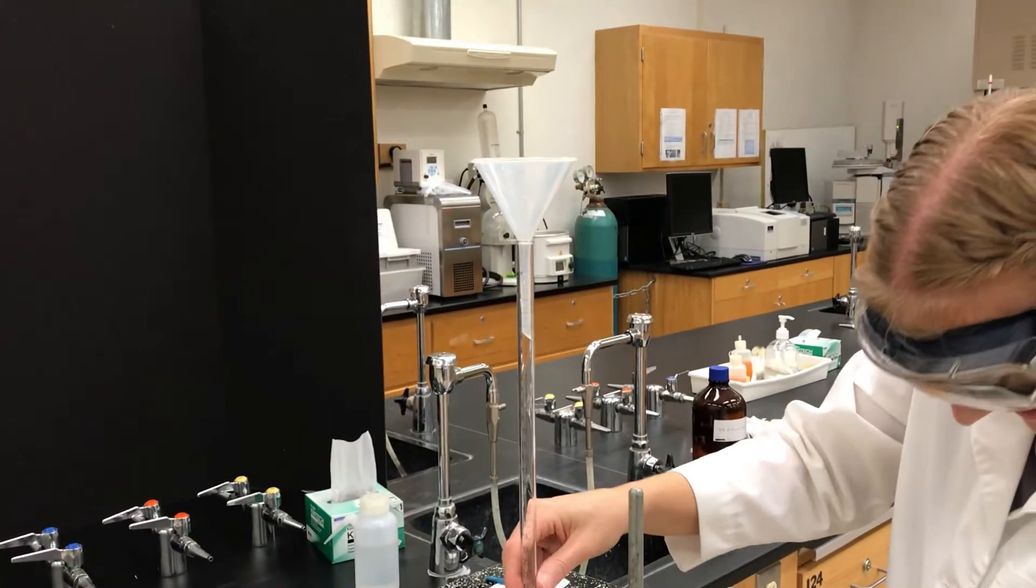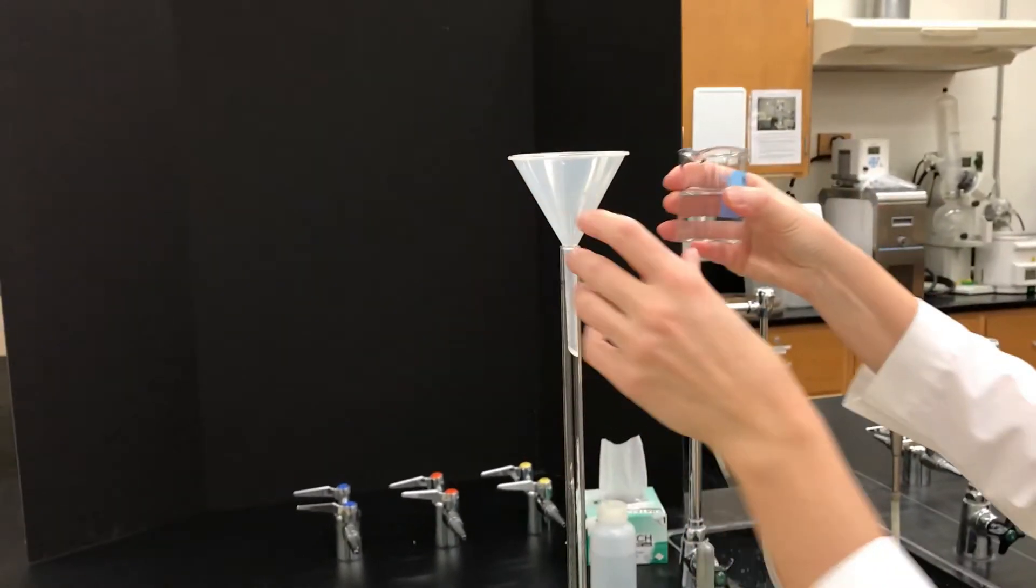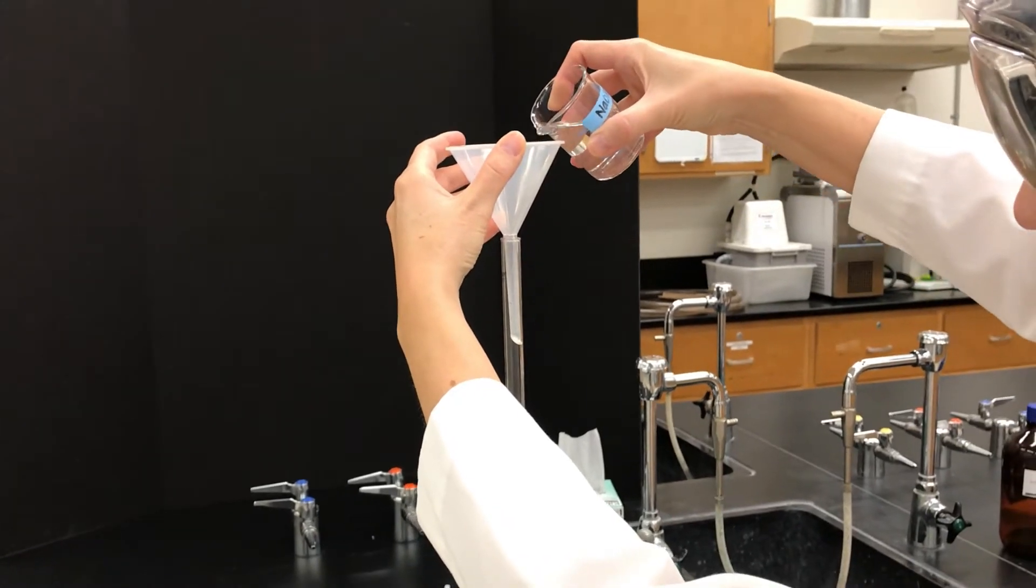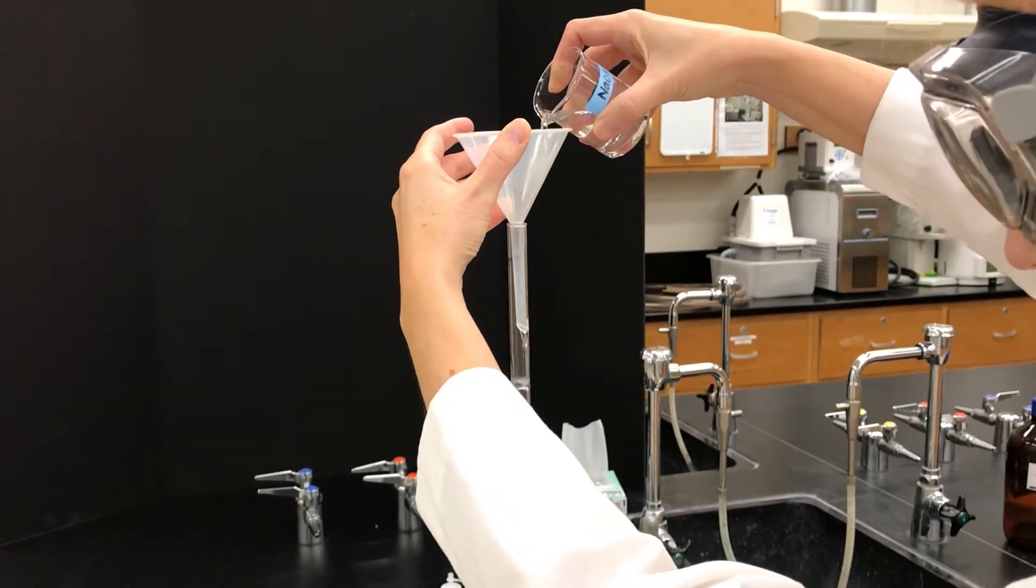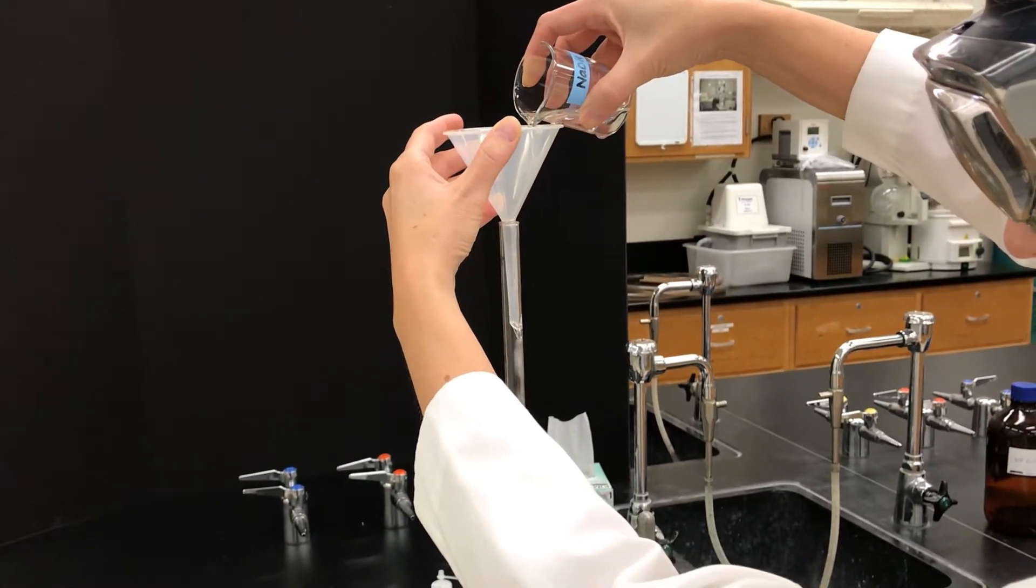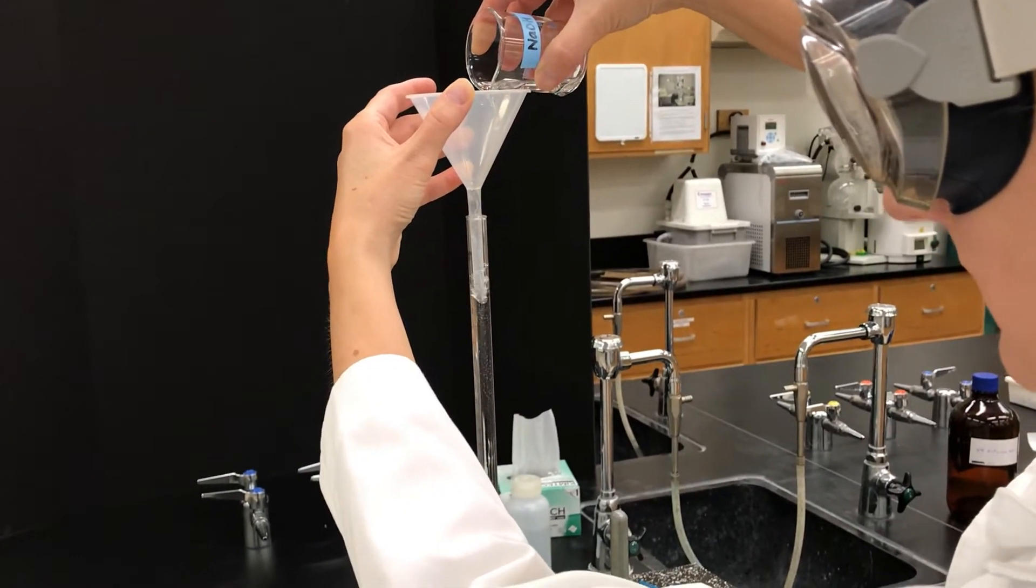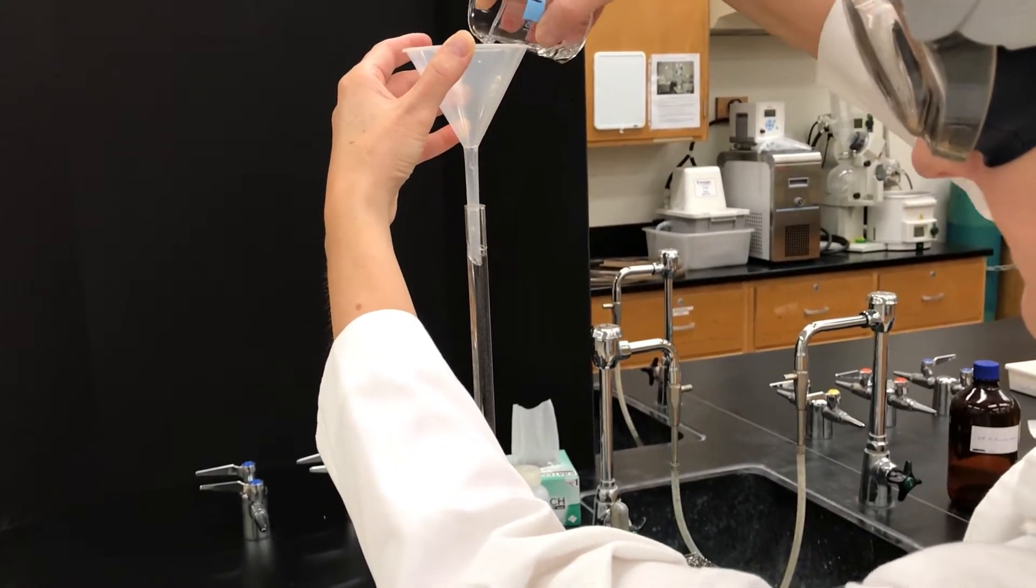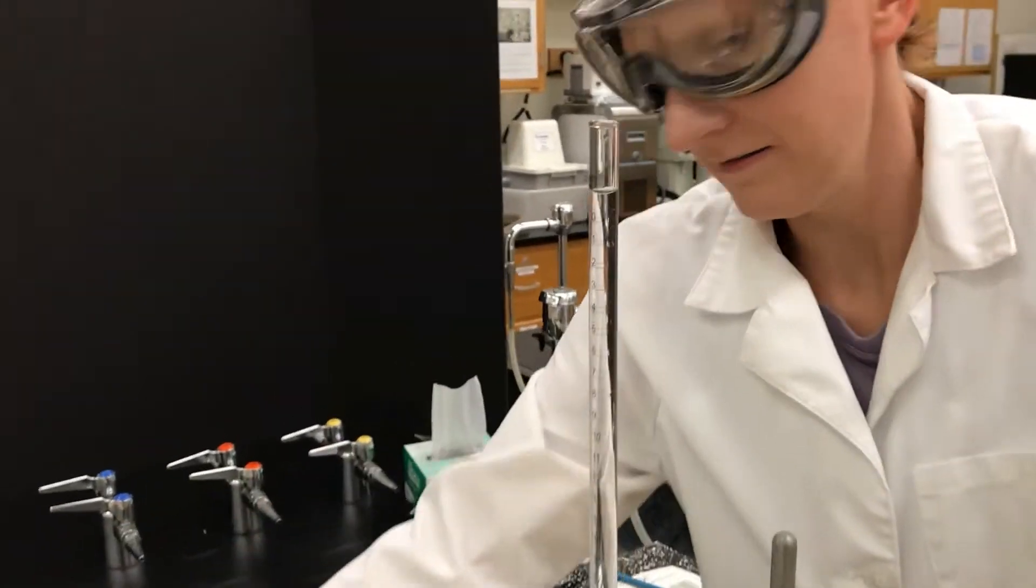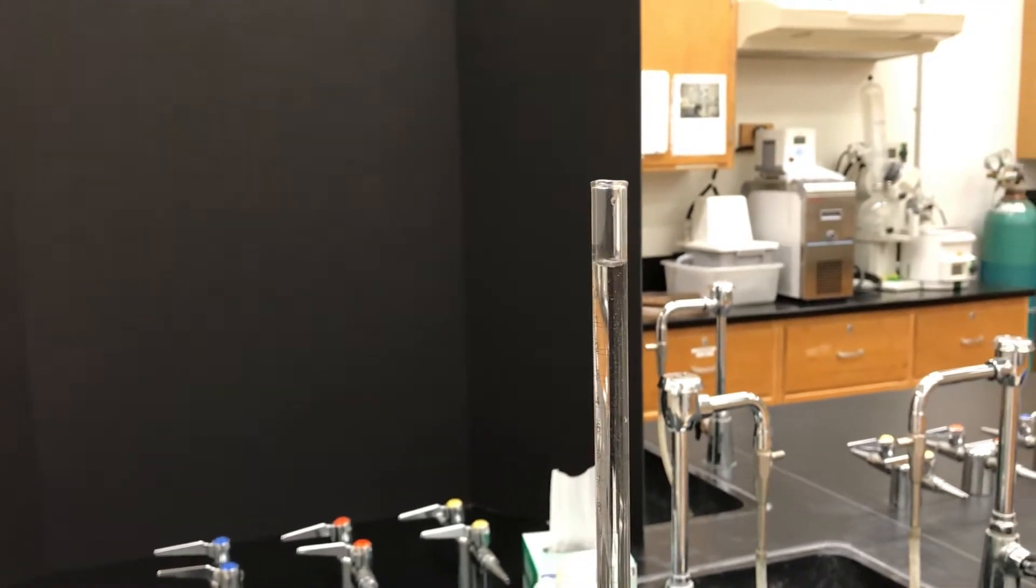After the rinse now you're going to fill it completely. Using the funnel and lifting that up somewhat, pour your solution in and watch the liquid because you can easily just pour in too much so that it spills out, but just track it so that you can fill it to pretty near the top. You do want to fill it higher than the zero mark.